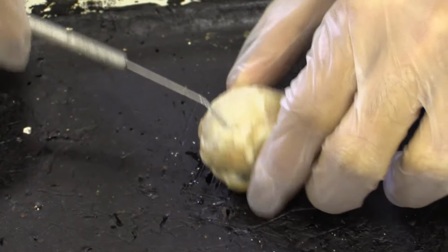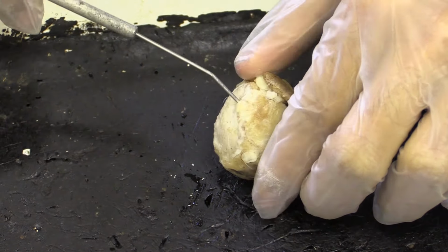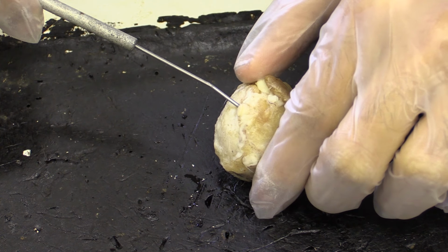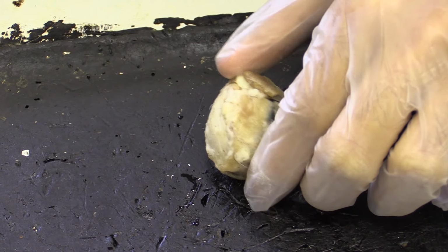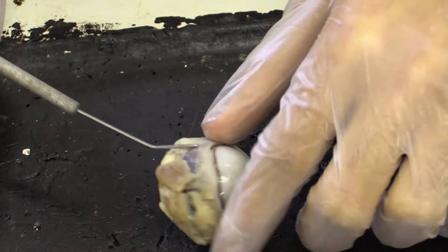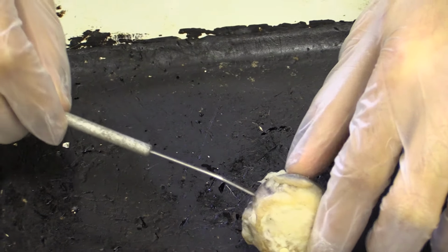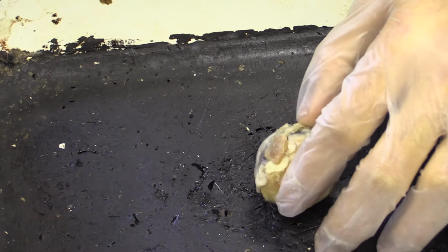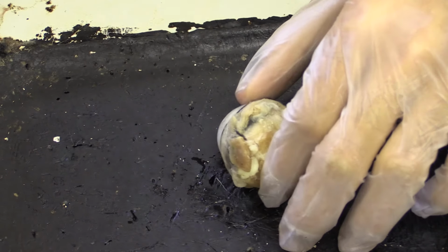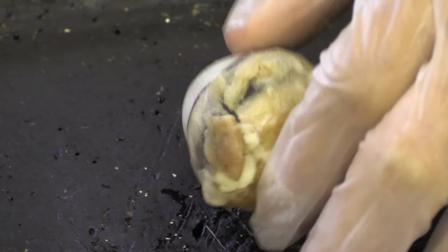And if we go to the back of the eye, we can see here this structure, which is the optic nerve. It's been cut off, but you can see it's coming out around the back of the eye. This is the optic nerve, and it goes directly to the occipital lobe at the back of the cerebrum in the brain. And then just around the eye, you can see this brown tissue all around it. And most of it's been cut off, for example here, but that's actually muscle used to make movements with the eye. That's why you can keep your head still and move your eyes round.